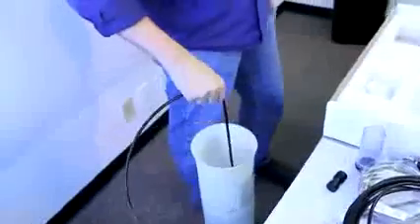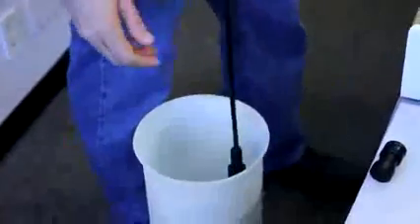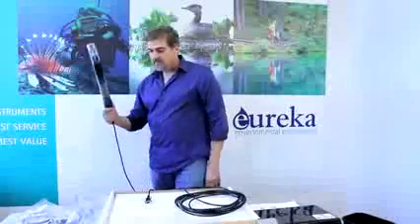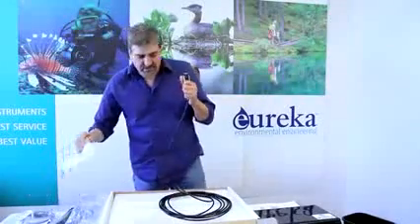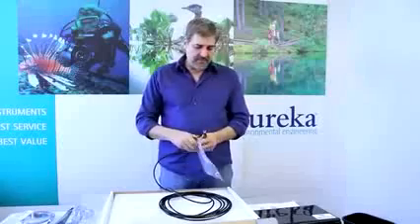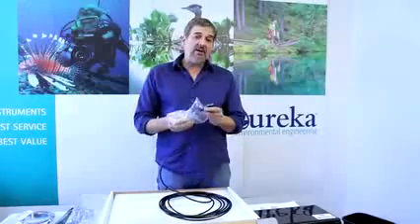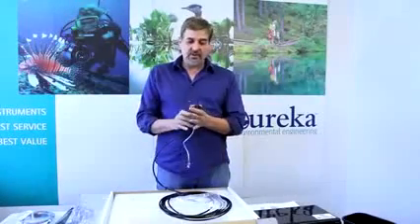Now it's ready to be dropped in water, lake, river, stream, whatever it may be. Now we're going to attach this to the PC. But prior to doing that, we're going to load our software.